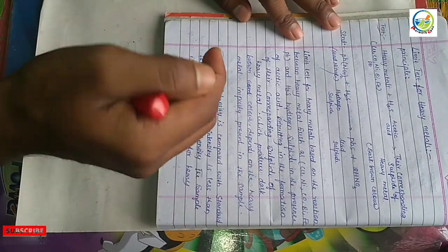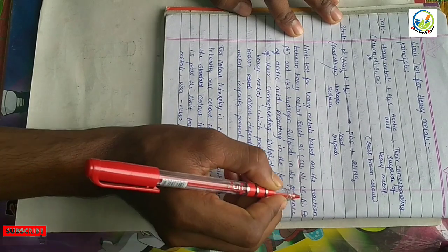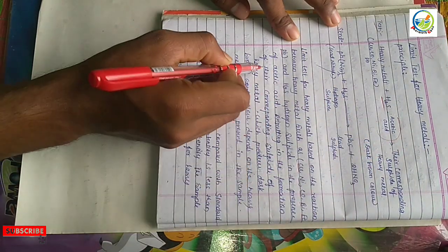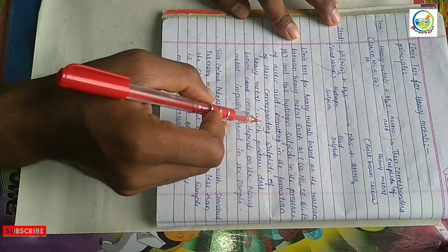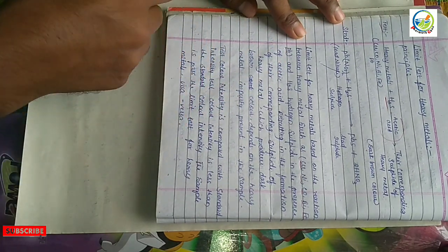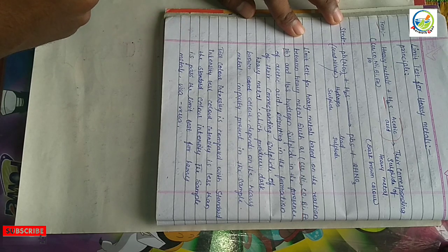The limit test for heavy metals is based on the reaction between heavy metals such as copper, nickel, cobalt, bismuth, iron, and lead, with hydrogen sulfide gas in the presence of acetic acid. This results in the formation of their corresponding sulfides, producing a dark brown color. The test intensity is compared with the standard intensity — if the test intensity is less than the standard, the sample passes the limit test for heavy metals.